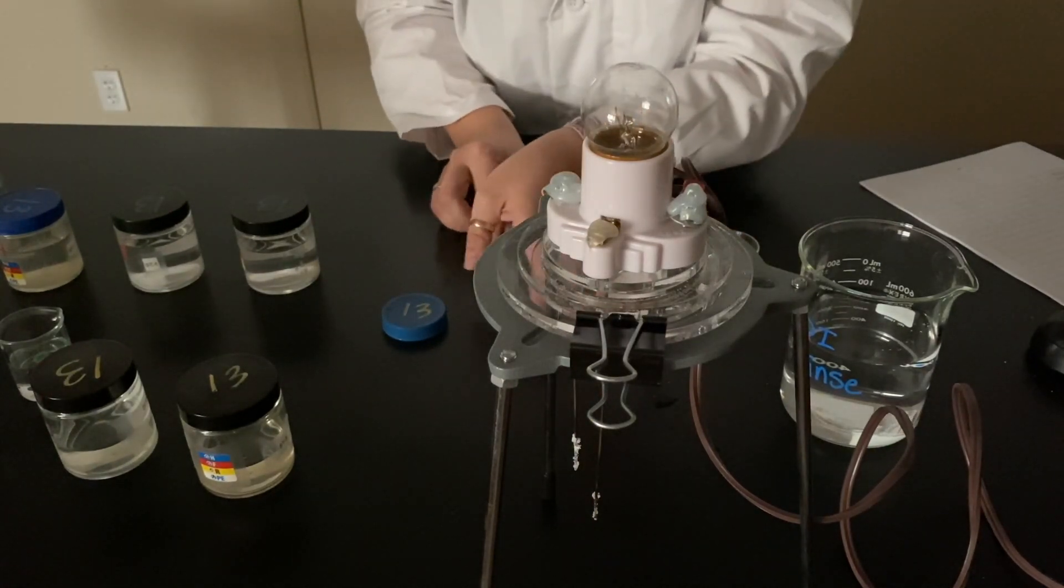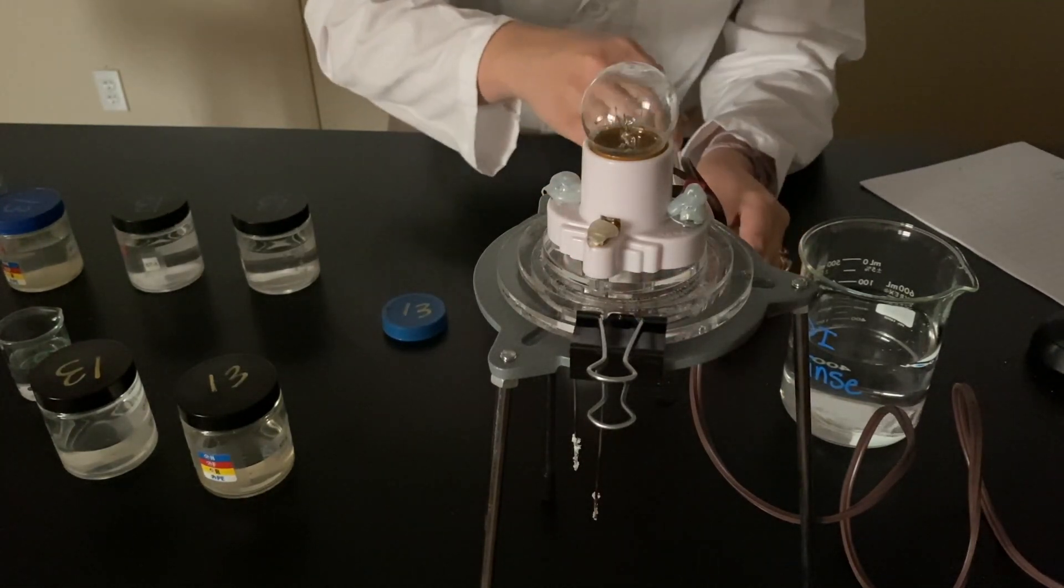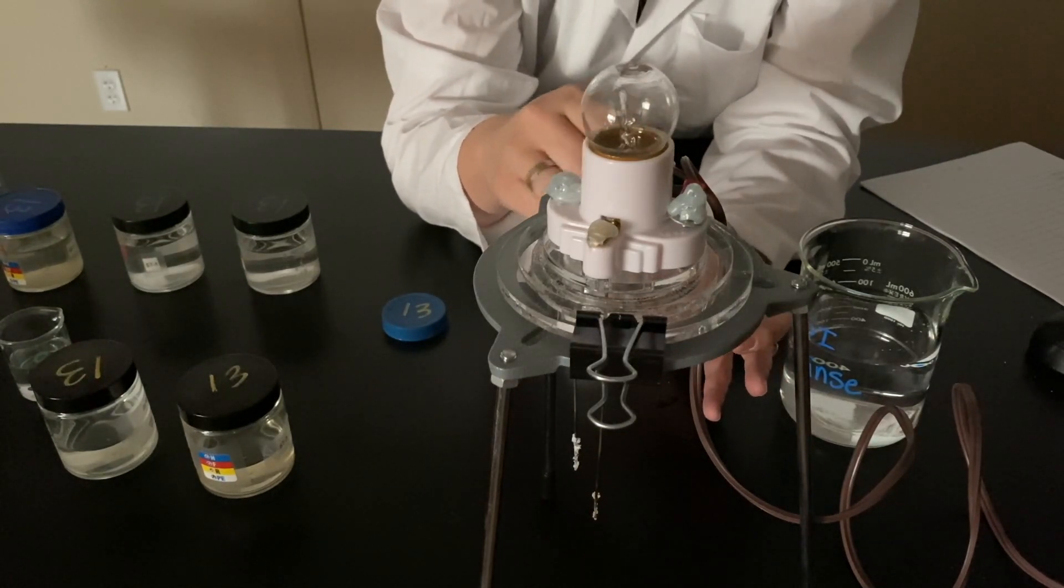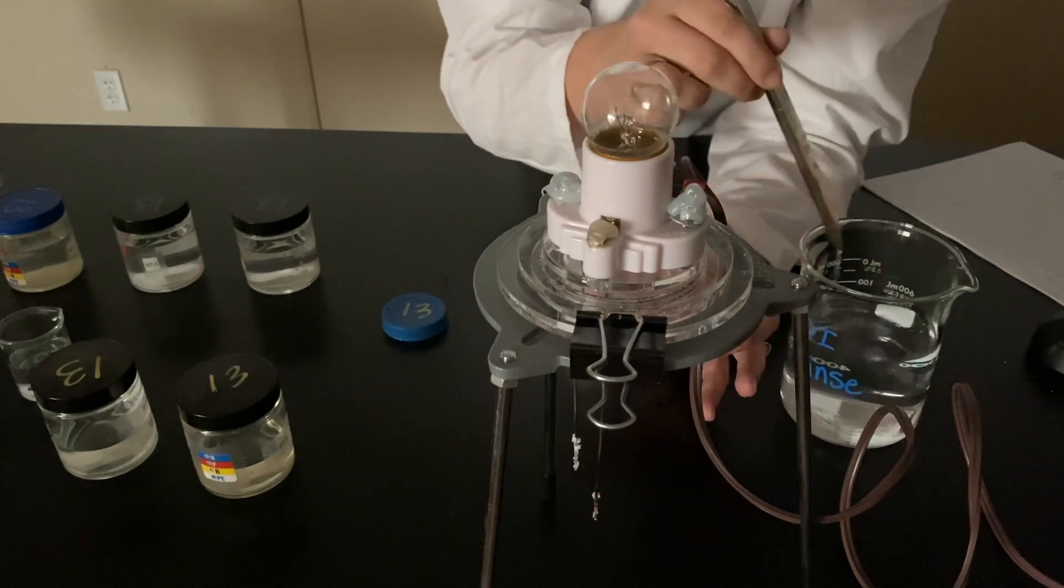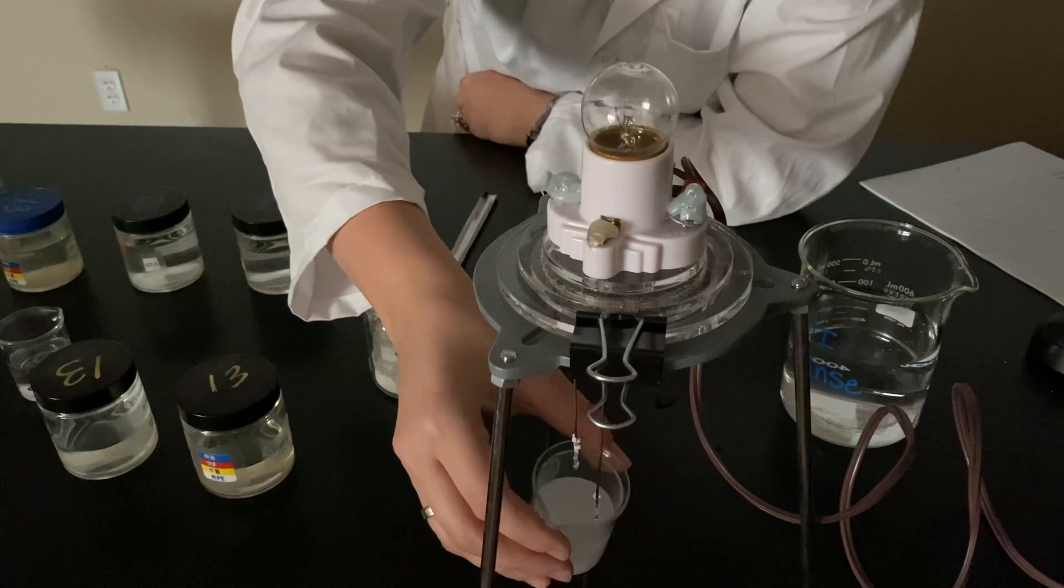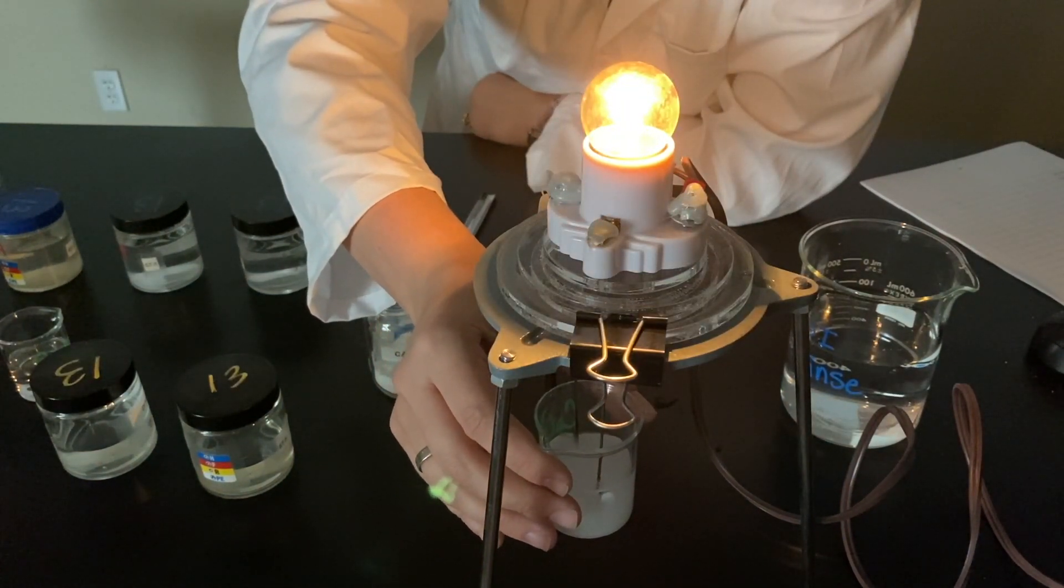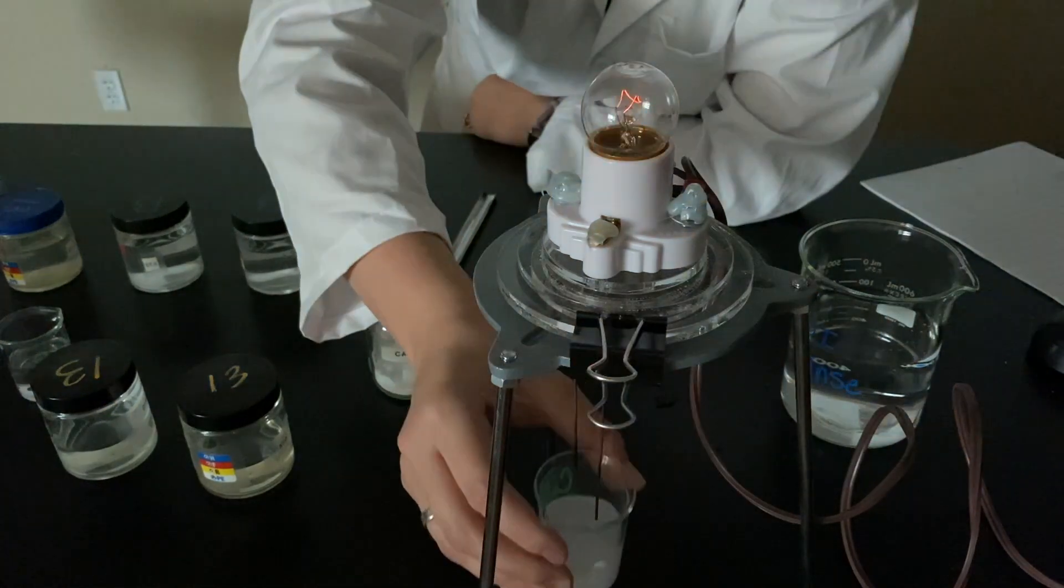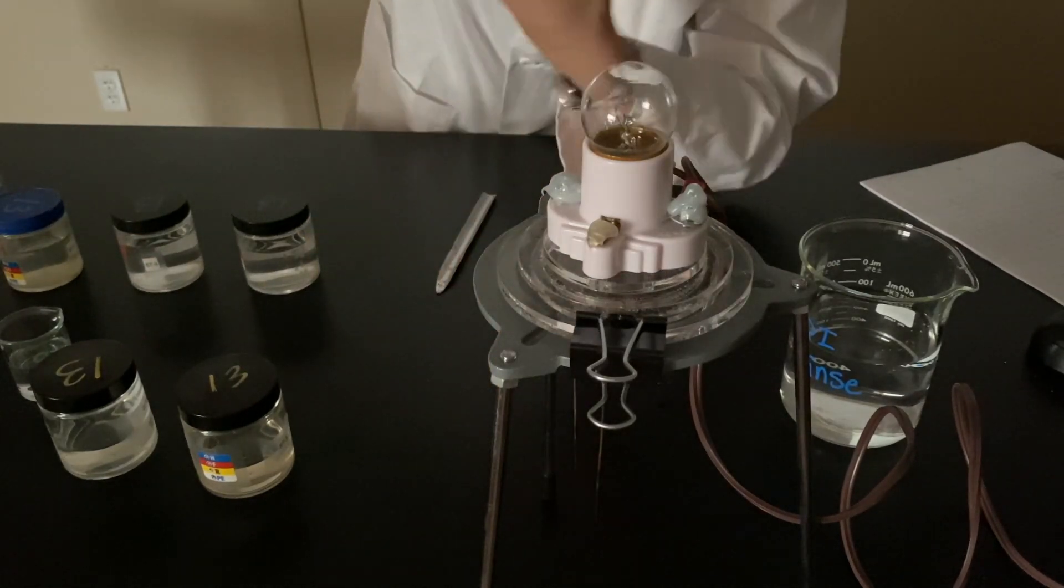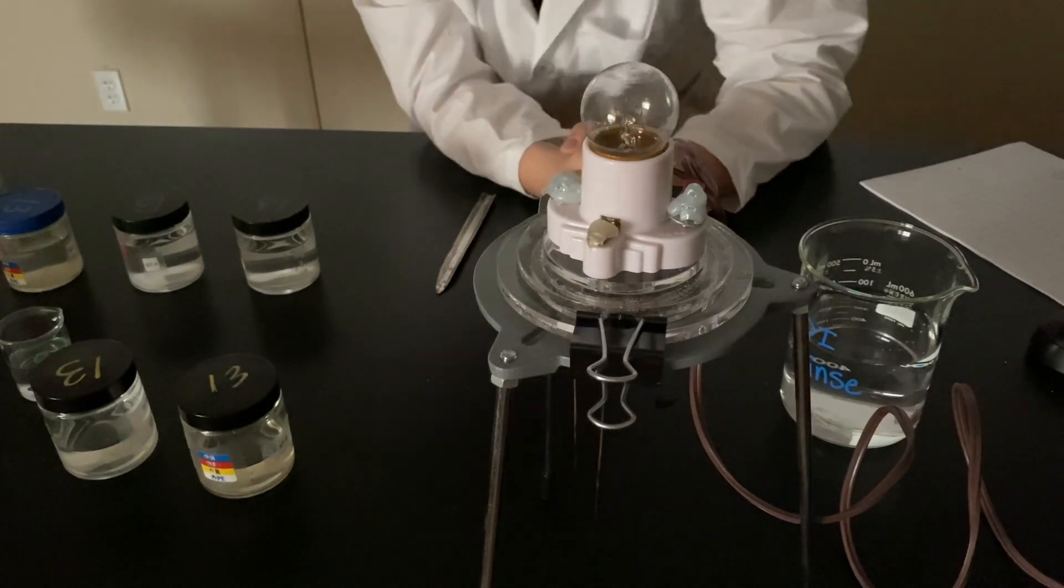Versus calcium carbonate aqueous. Take a little scoop. Put it into the DI water. Mixy, mixy, mix. And this is a cloudy solution, you'll notice. All right. Here we go. Calcium carbonate in a solution, aqueous.